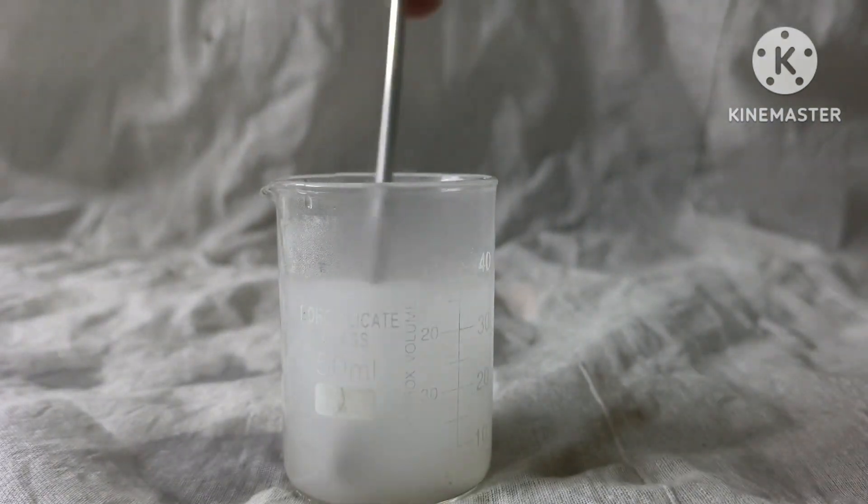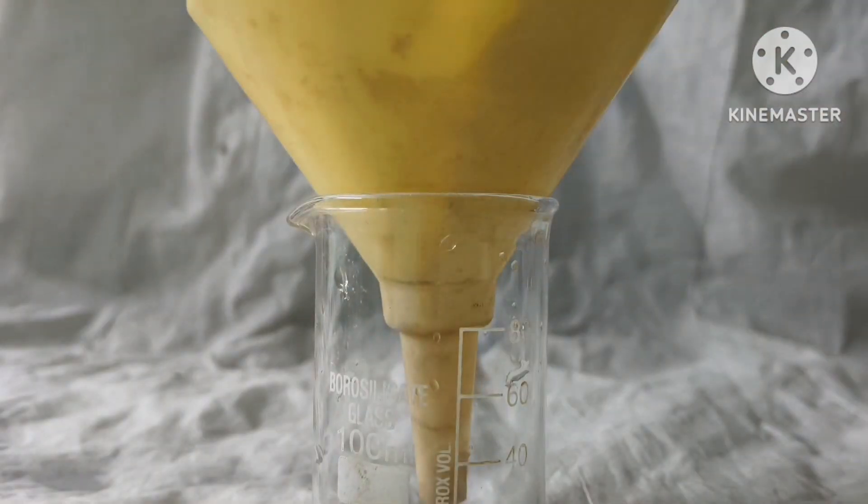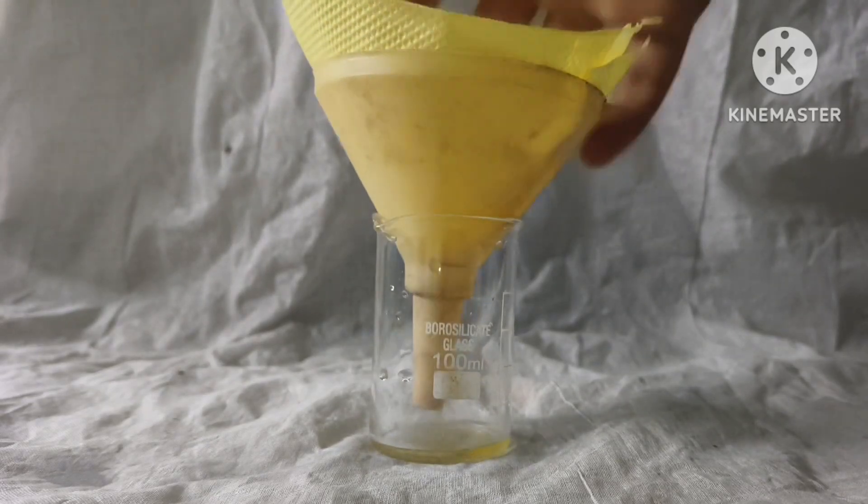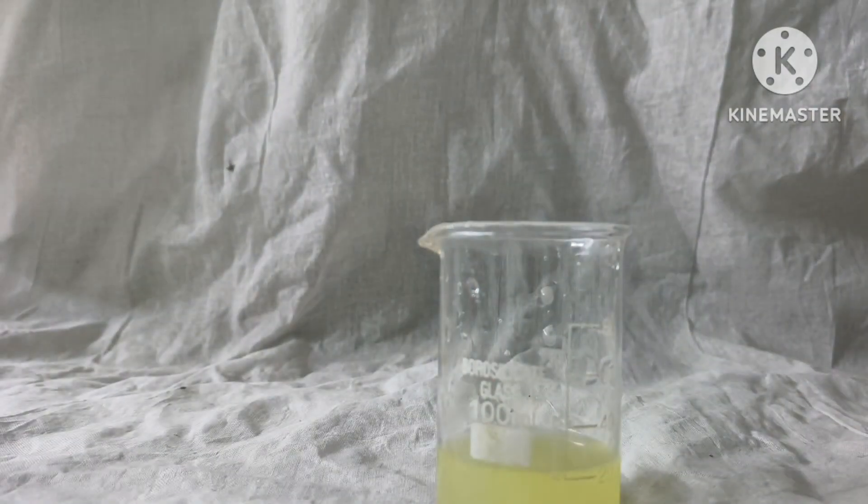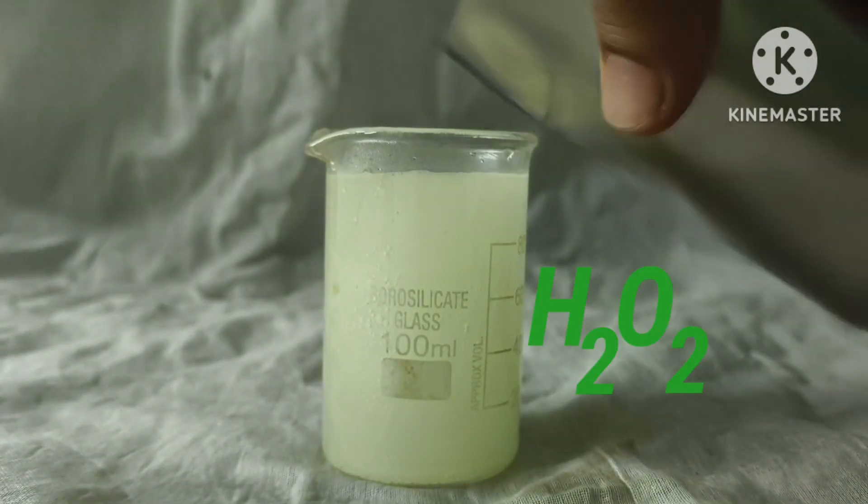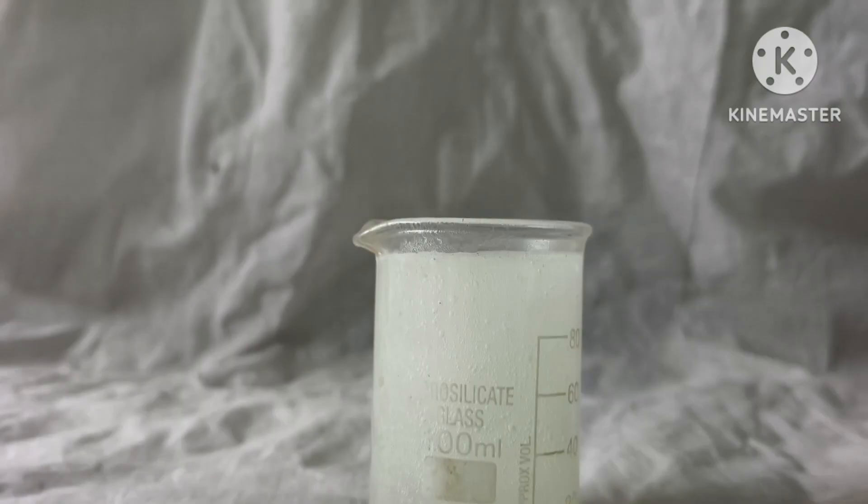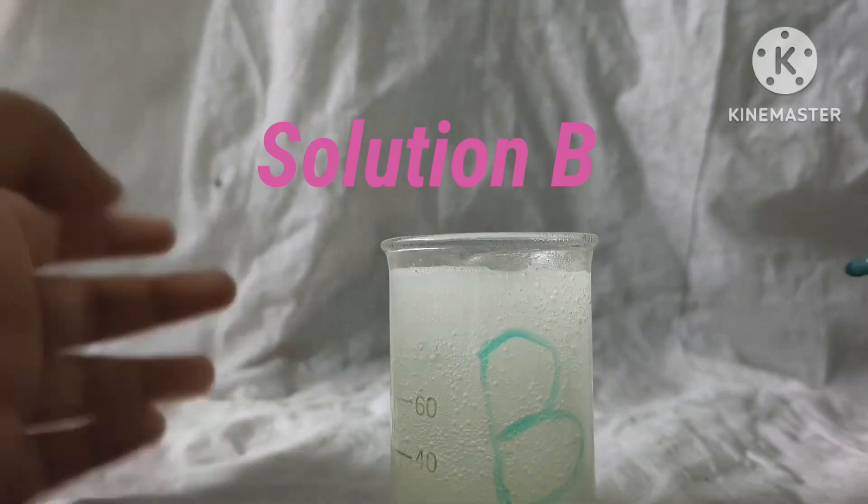I added some hydrogen peroxide, but I accidentally turned off the video and was unable to record it. I marked the solution as solution B.